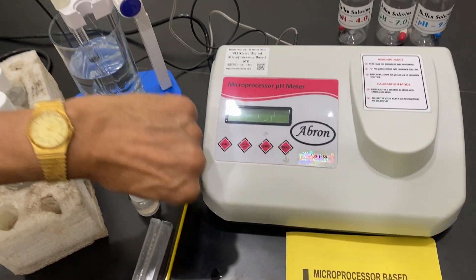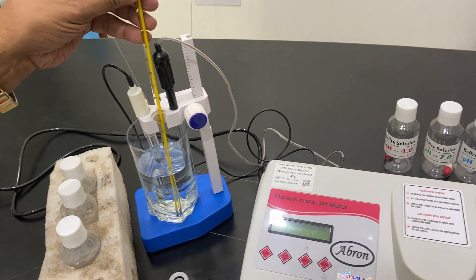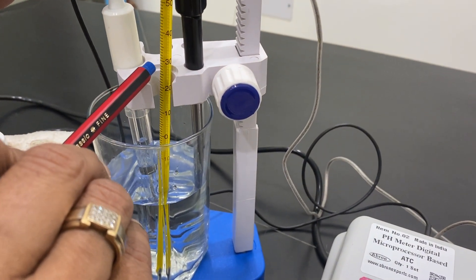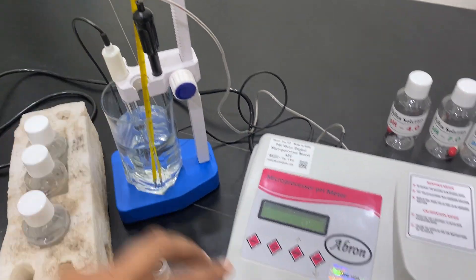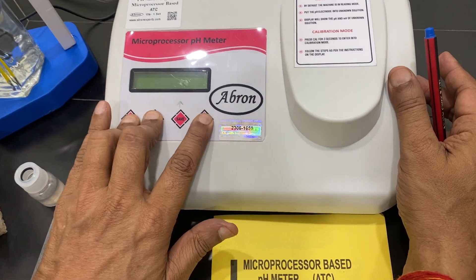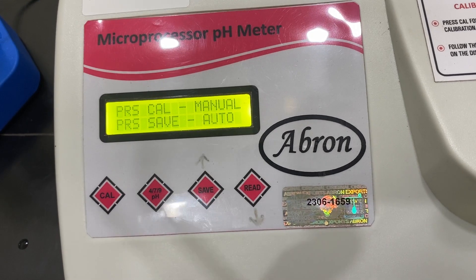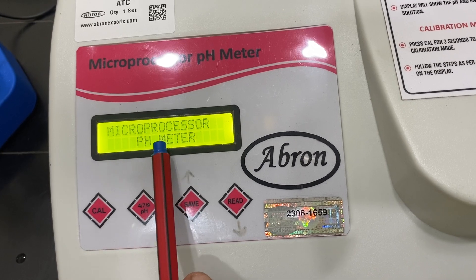For temperature calibration, I can put my thermometer in and see the temperature. The temperature is almost 29, a little above 29. If I want to calibrate the temperature, just switch on, keep it pressed, and read. It enters temperature mode, then calibration mode. Press save — it shows automatic mode.